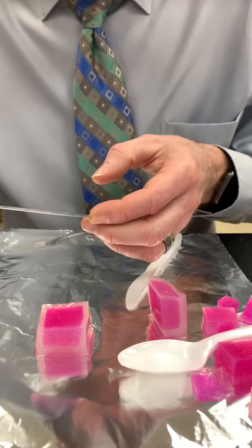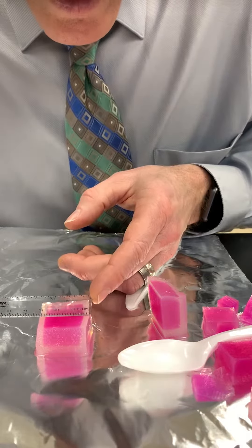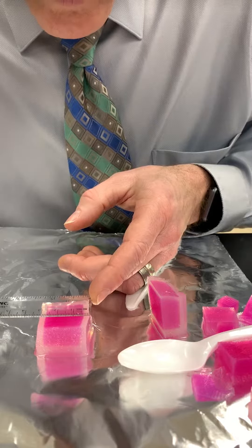Which is in centimeters, and I measure. I get one, two, three... 0.4... 0.35 centimeters.